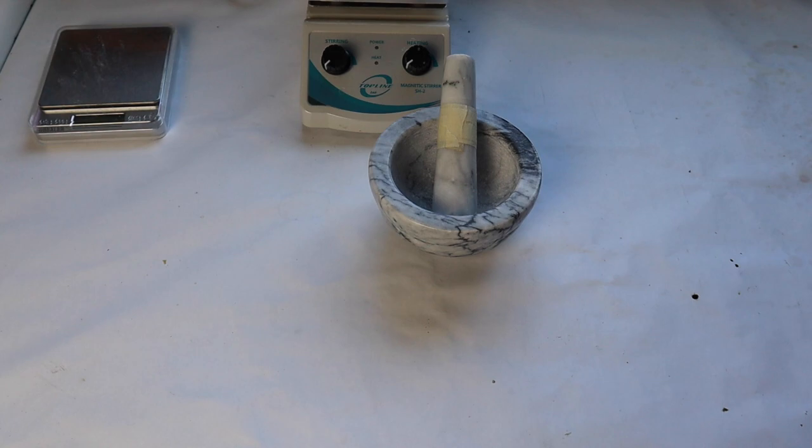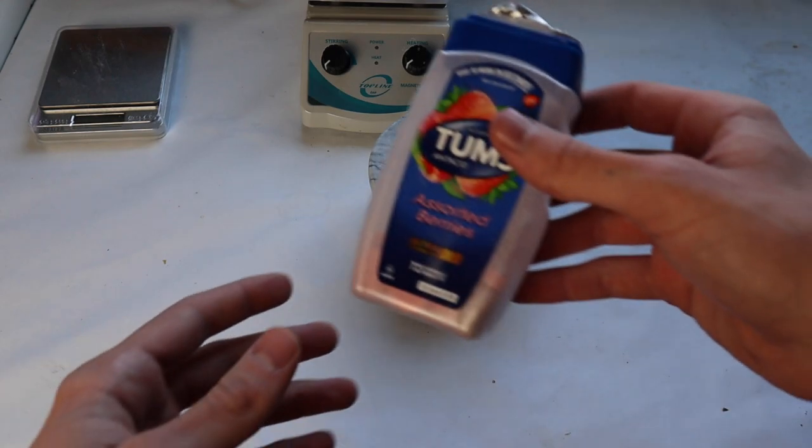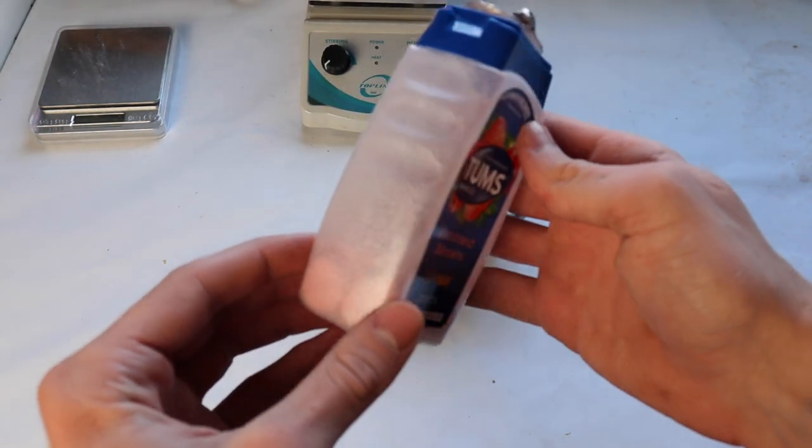I recently made a video where I extracted the active ingredient from aspirin. I thought it was pretty cool to extract something from a household medicine. So I'm going to do the same thing, this time for Tums.